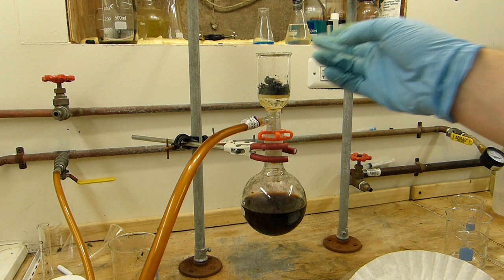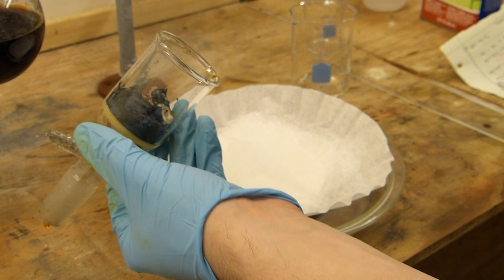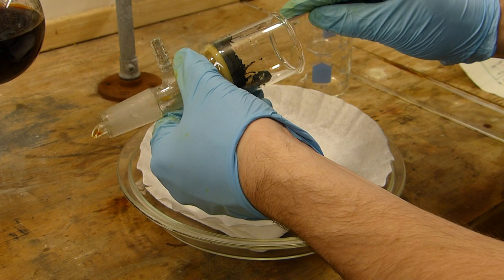The aspirator is now off and we can go ahead and scrape the iodine out of the funnel there. I've got the drying plate ready. And I'm going to use a flat spatula like this to just scrape it out.